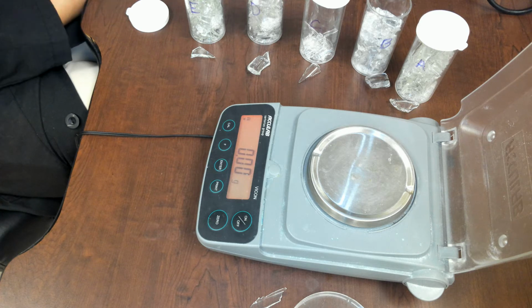Okay, so today we're gonna do a glass lab. It's a lab on glass identification. Our objective is to determine the density of several glass samples so you can determine whether or not two glass samples originated from the same piece. We're gonna be looking at part one only today, at least in this video.